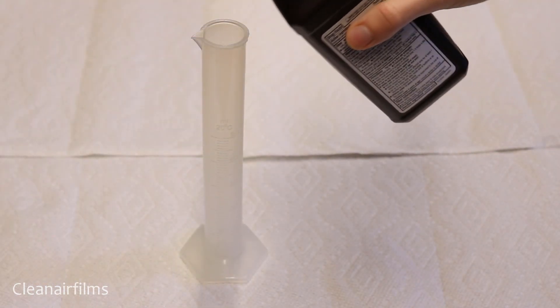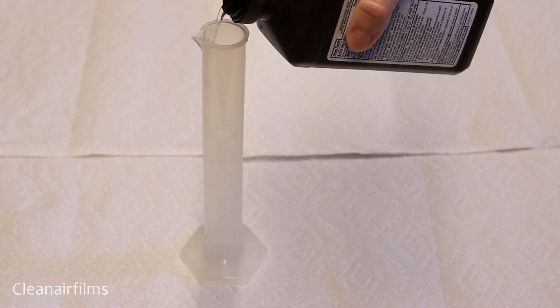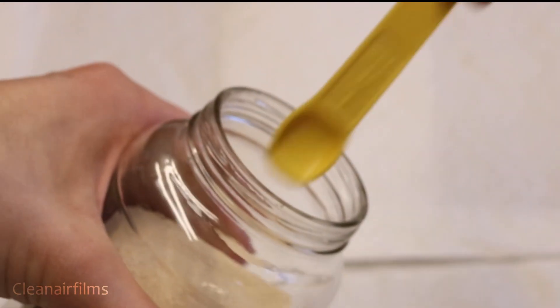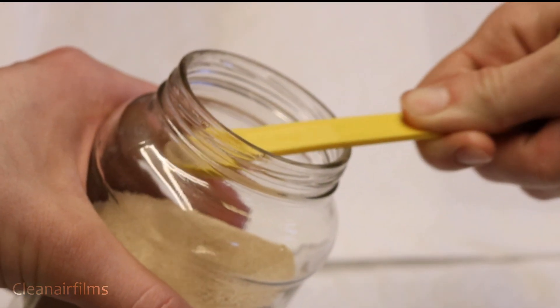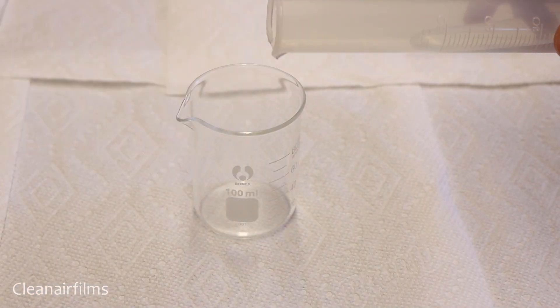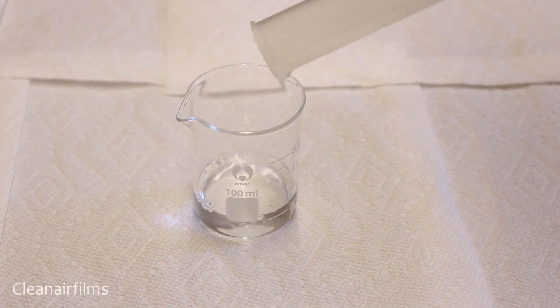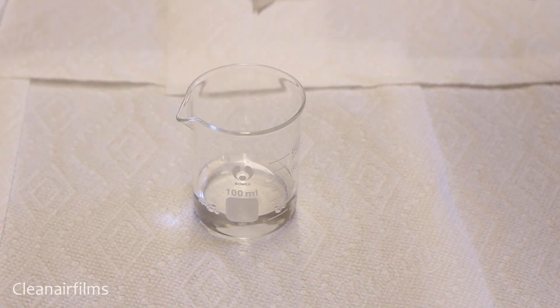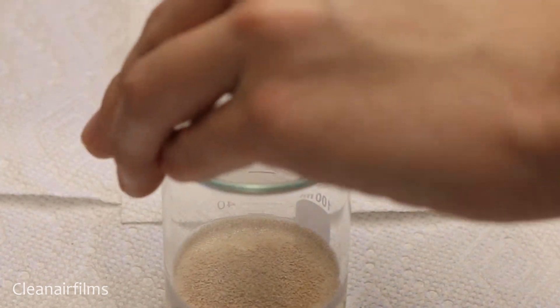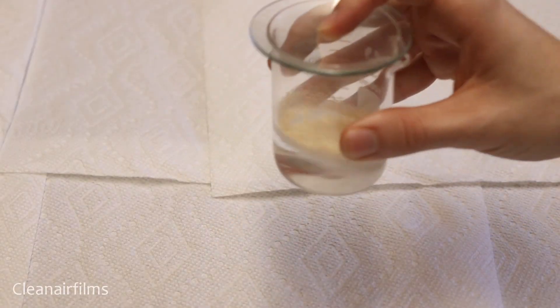To begin, let's measure out 25 milliliters of hydrogen peroxide and then measure a quarter of a teaspoon of yeast. Pour the hydrogen peroxide into the beaker. Now add the yeast to the hydrogen peroxide and place the watch glass over the beaker.